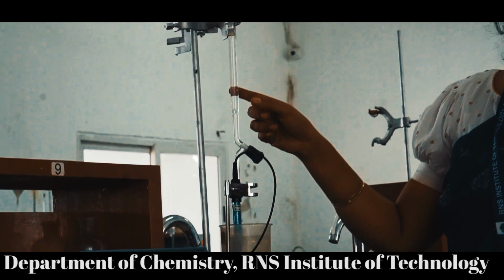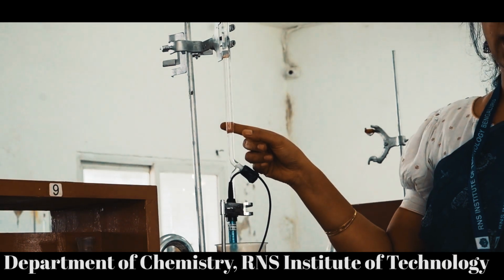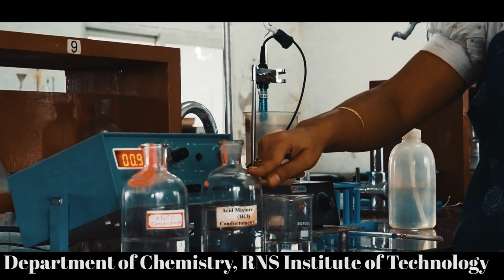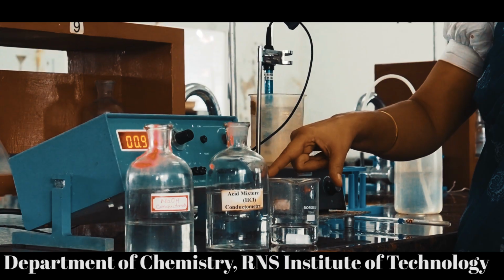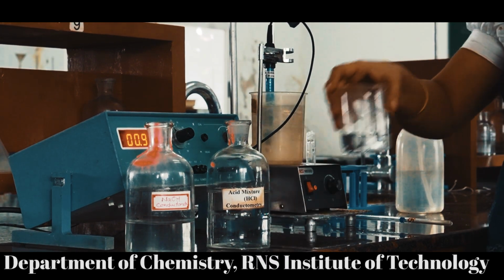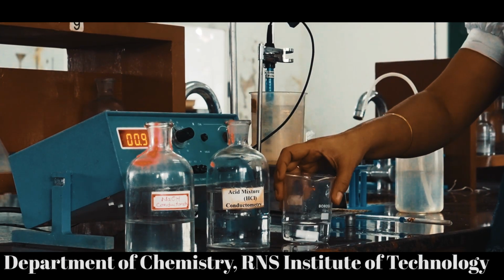So the first step, we should pour the burette with the titrant, that is sodium hydroxide. Then to the beaker, we should keep 25 ml of the acid mixture, then 1 test tube of demineralized water. Since we are using a magnetic stirrer here, we have taken the magnetic bead.